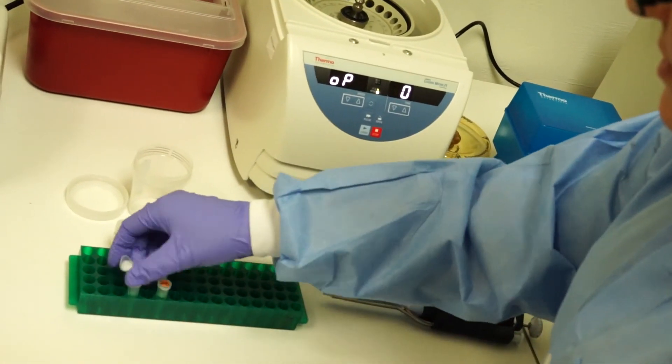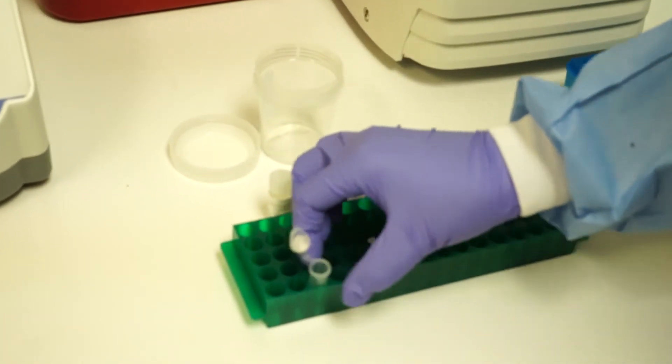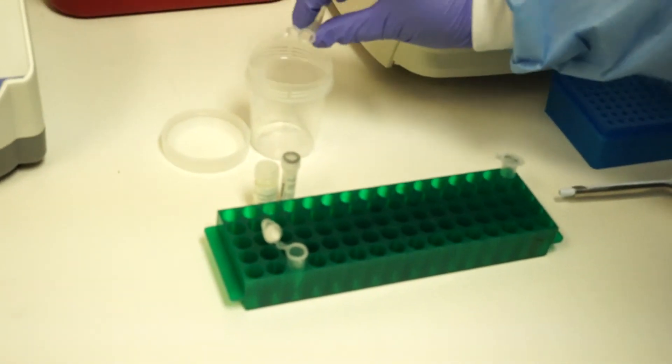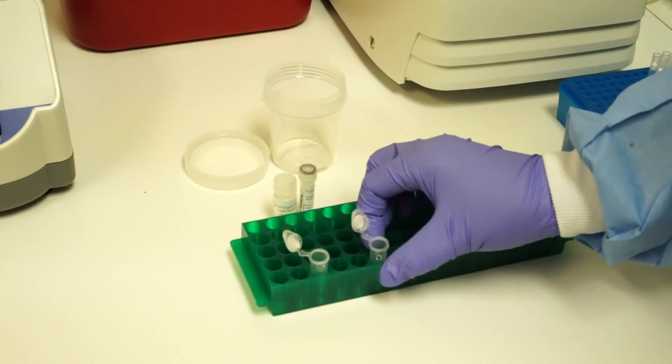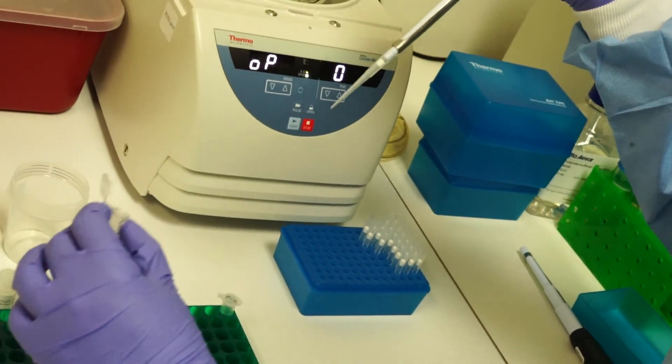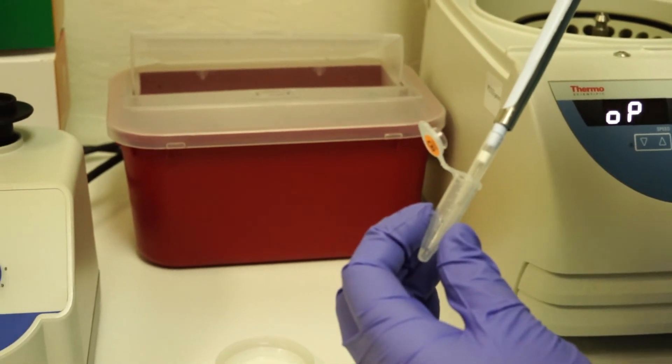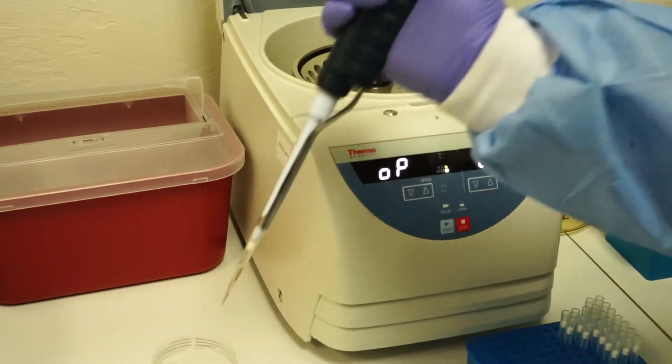Discard the supernatant by carefully decanting and retain the pellet. It's necessary to remove excess buffer with a pipette.